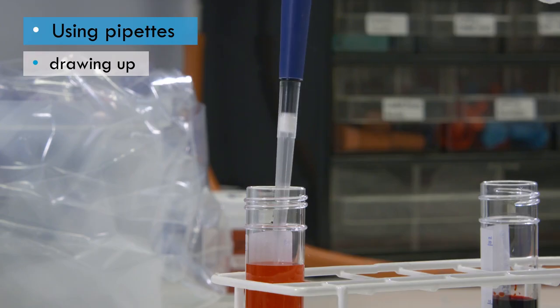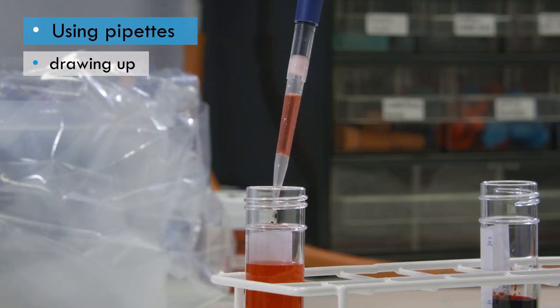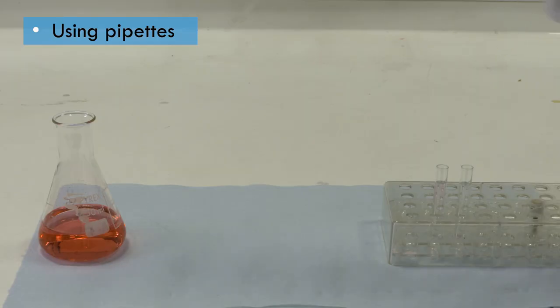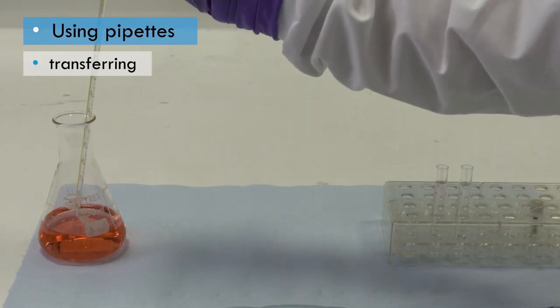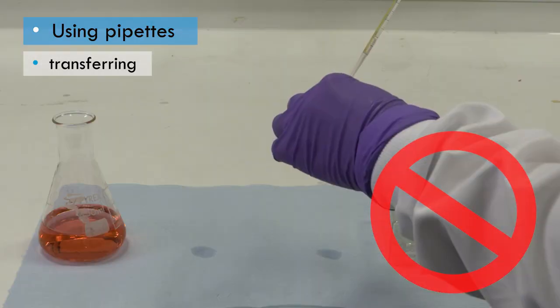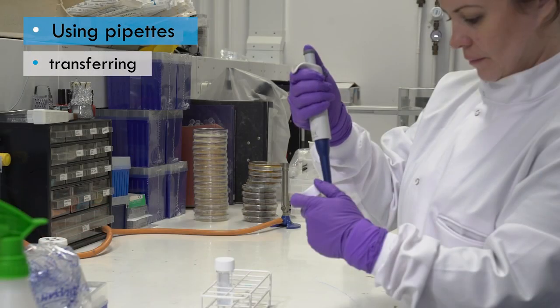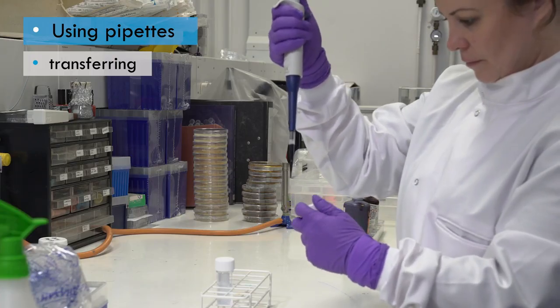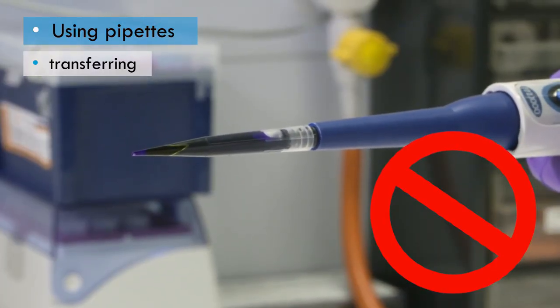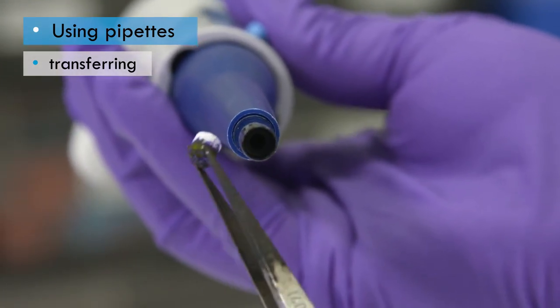Draw liquid up slowly to avoid sucking up air. If the action is too quick, then you will trap air and probably contaminate the filter. Move slowly when transferring between two places. Try to make sure they are as close as possible to avoid the risk of dripping potentially hazardous liquids. Make sure that the pipette is held upright and not horizontally to avoid contamination of the filter and pipette. If the filter becomes contaminated, it will have to be replaced.